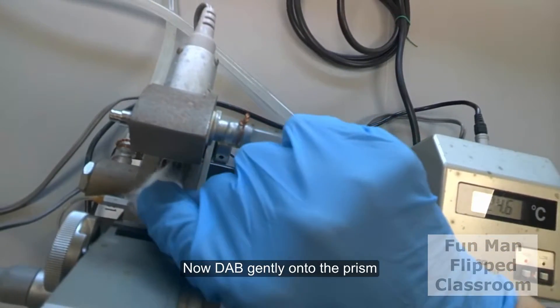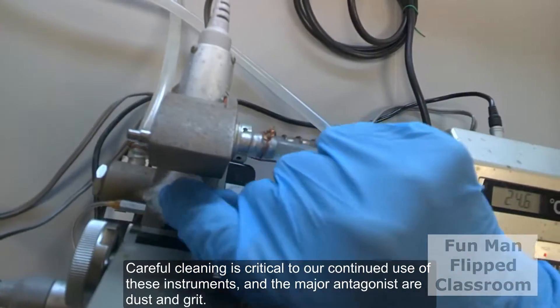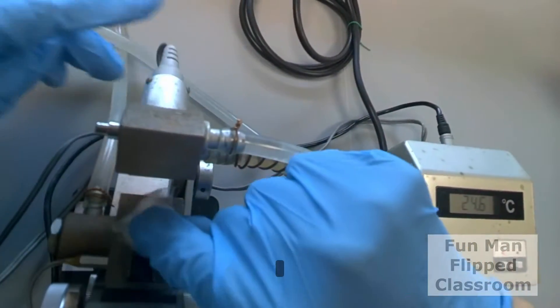Now careful cleaning is critical to our continual use of these instruments and the major antagonists are dust and grit. So any particle that scratches the prism glass is detrimental.